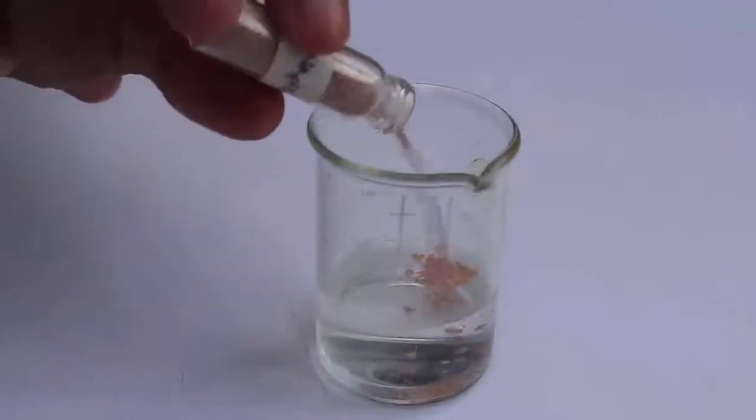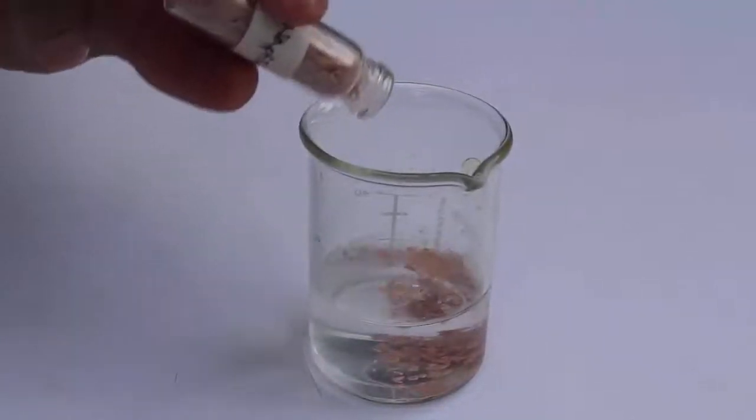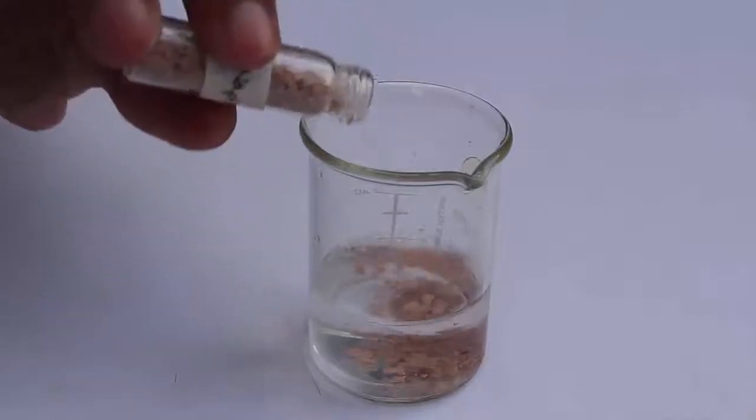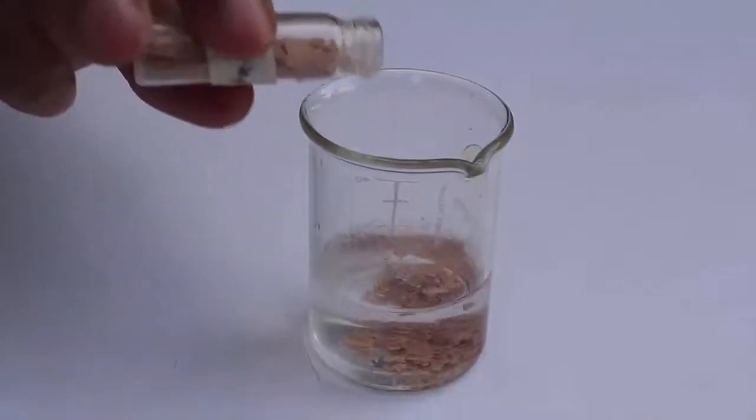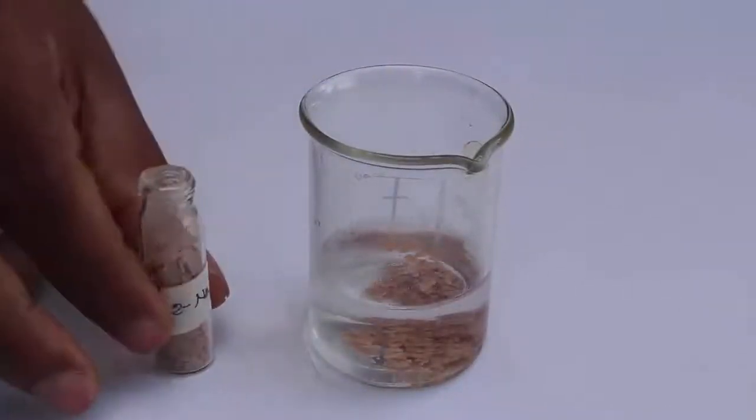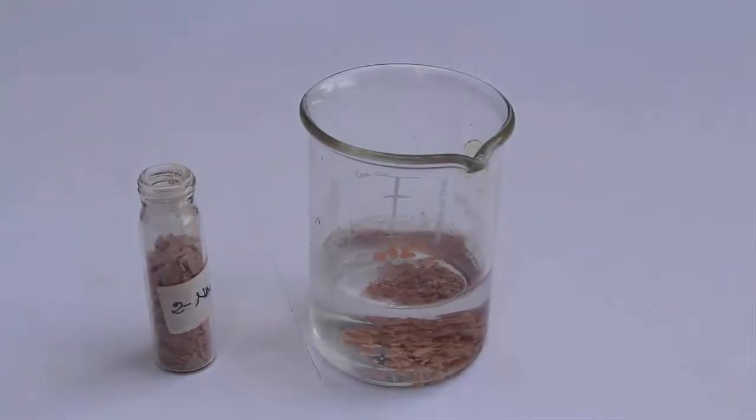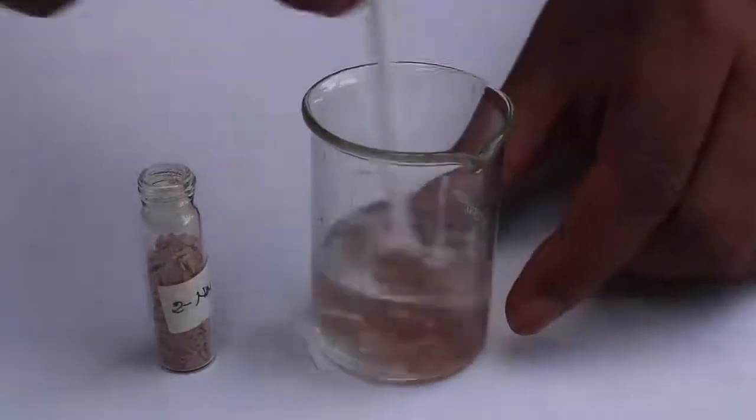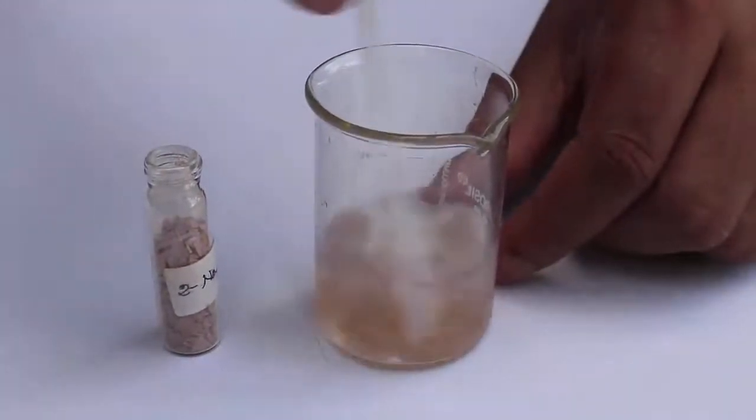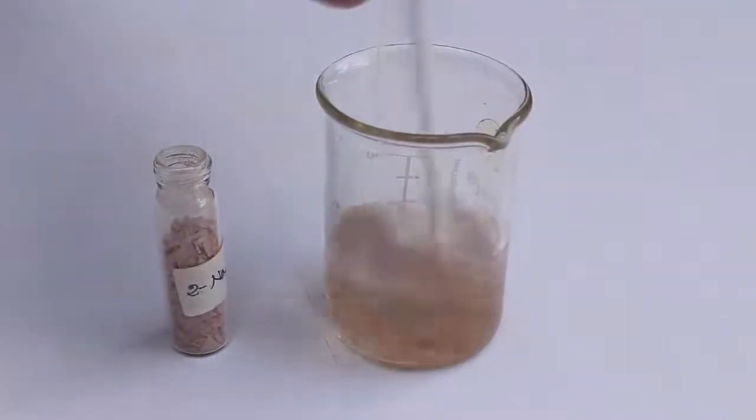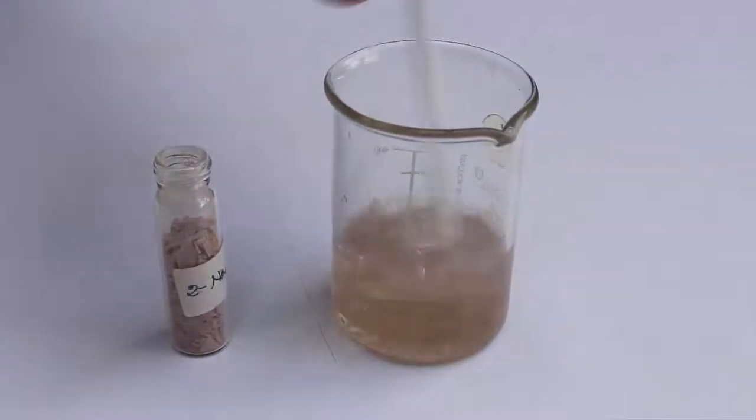To get a clear solution, you will have to stir this mixture for a long time until all the naphthol is dissolved. So be patient and keep stirring until all the naphthol in the mixture is dissolved.